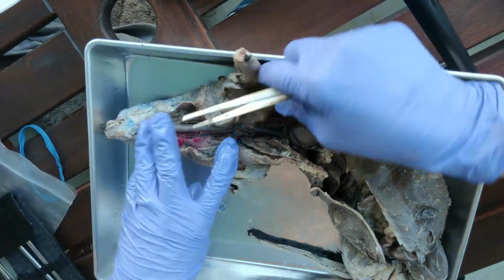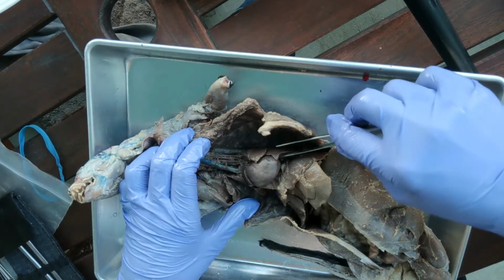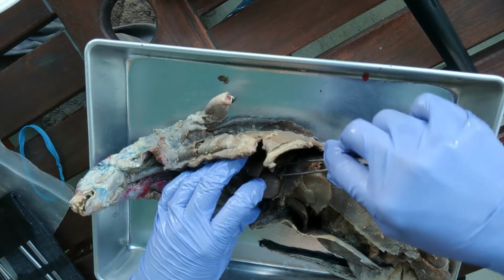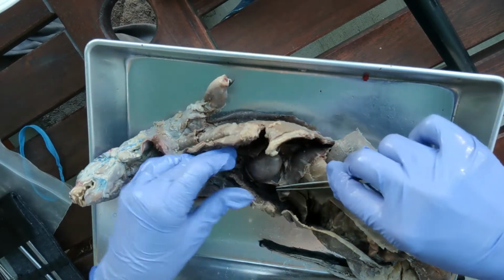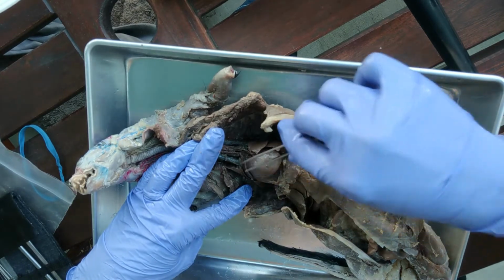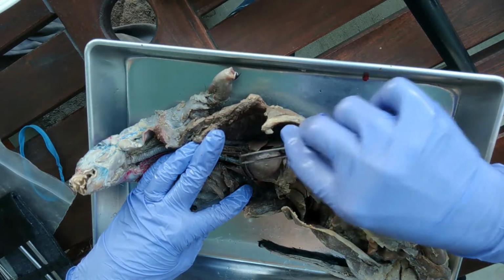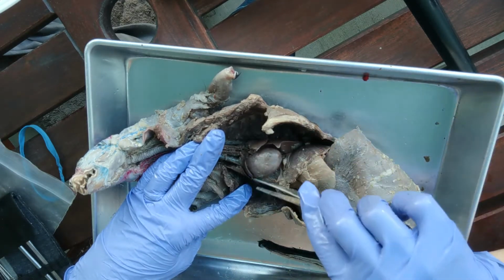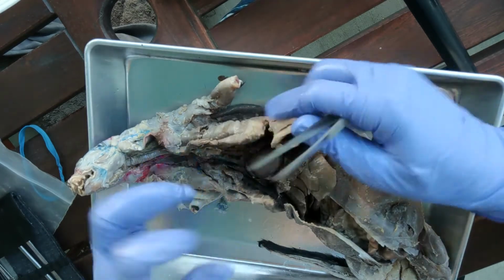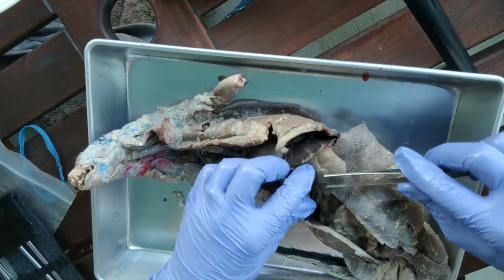And so if we follow it down here, this area here, this is the heart, and the heart used to be enclosed in a little pouch called the pericardial sac. So all I did was I opened that up, and this would be the heart, all of this here. Surrounding the heart, this is the lungs. Okay, so they sort of engulf the heart like that. Okay, so here's the diaphragm again.